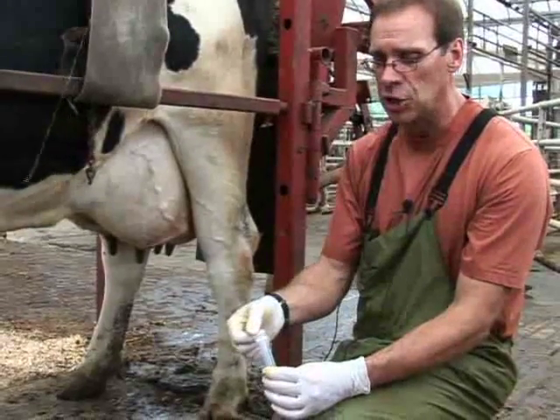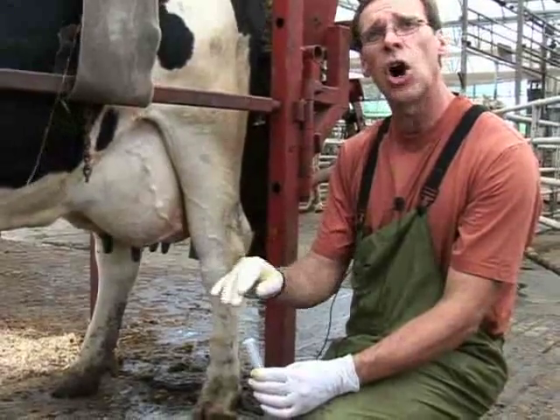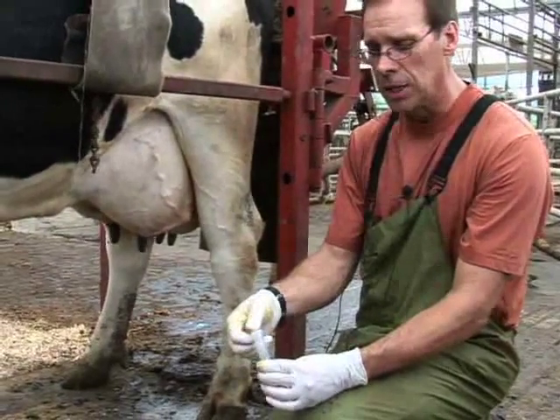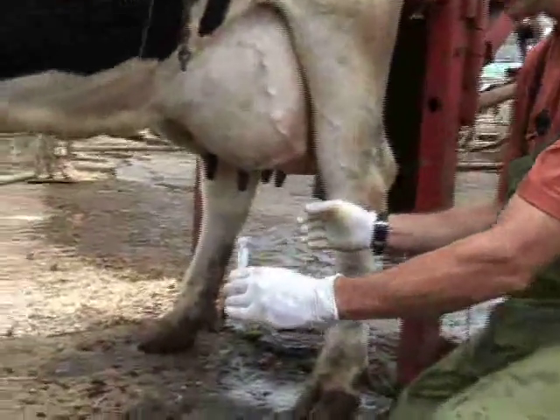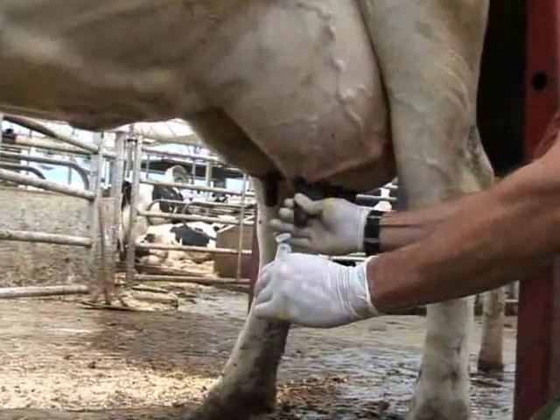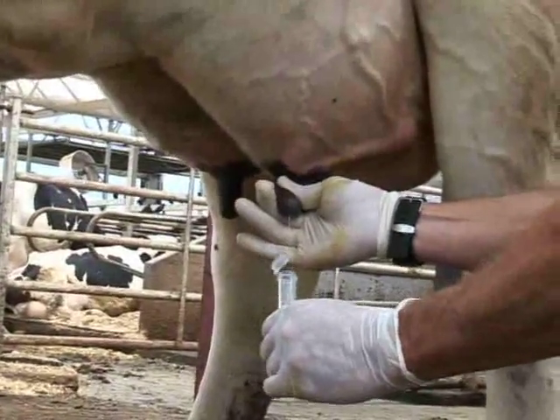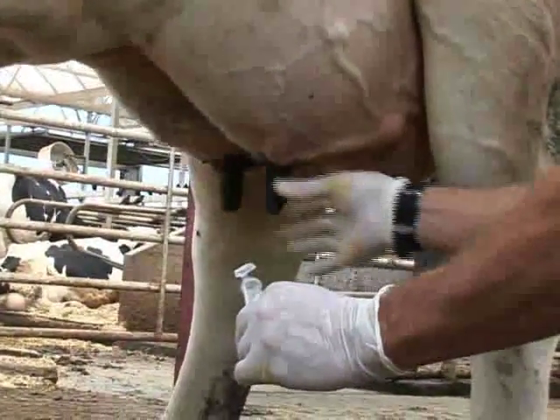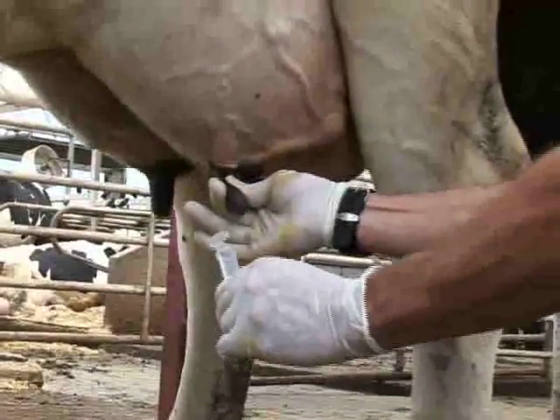The way we avoid debris is we allow the lid to act as a protector so that material will bounce off of it. At the same time, we need to direct the stream of milk into the tube at an angle. So now I'm going to open the lid and leave it half open like this. At an angle to the cow's teat, I'm going to strip milk — the fore milk is first stripped away onto the ground, not into the tube. Once we finish stripping onto the ground, then we collect the sample into the tube, using the lid as a buffer to prevent any material from falling into the vial.